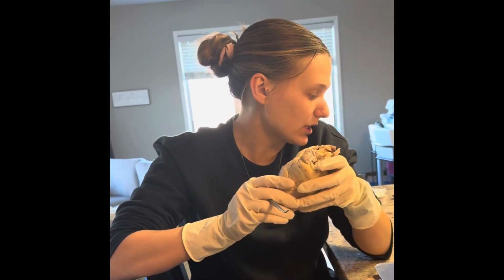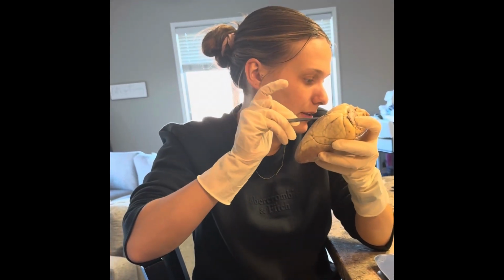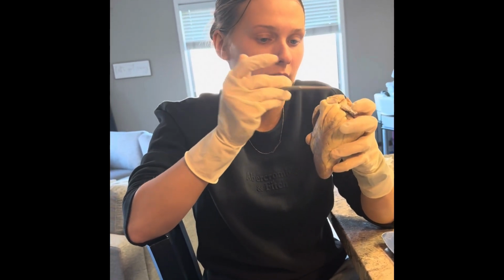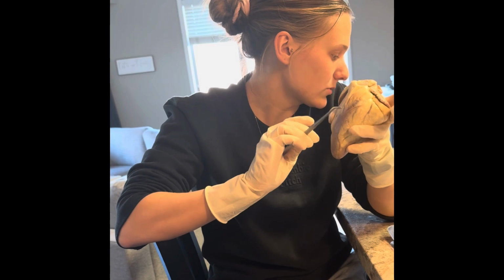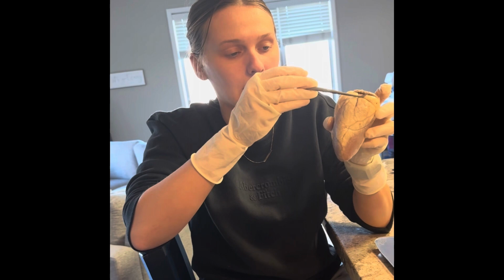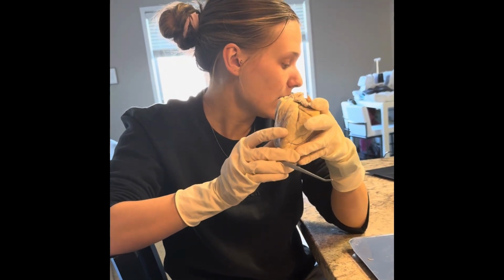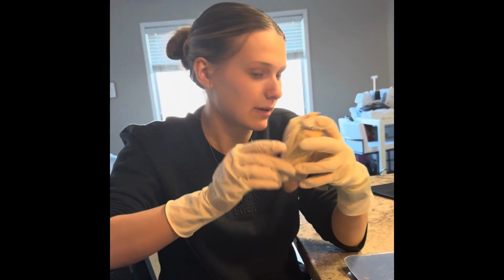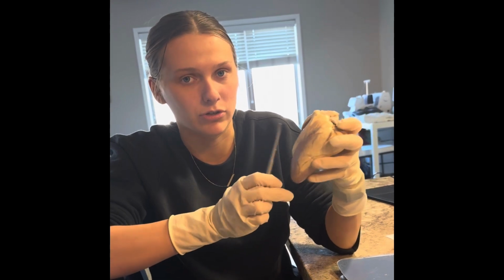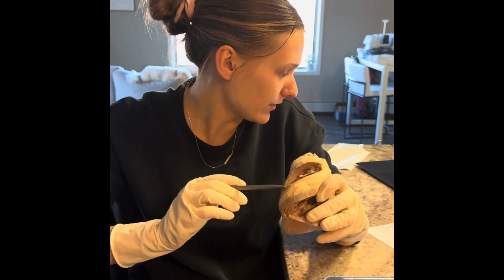And then the brachiocephalic trunk, that is another part of the heart, but that lays more right up here by the aorta. And then the next will be the chordae tendineae, and that is going to be near the right side of the ventricle, right over there. And then the other one will be the interventricular septum, and that is just what divides the right and left ventricle.